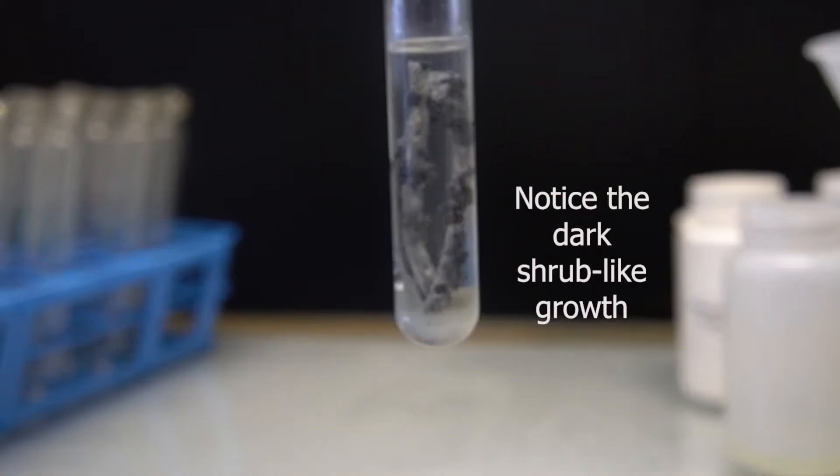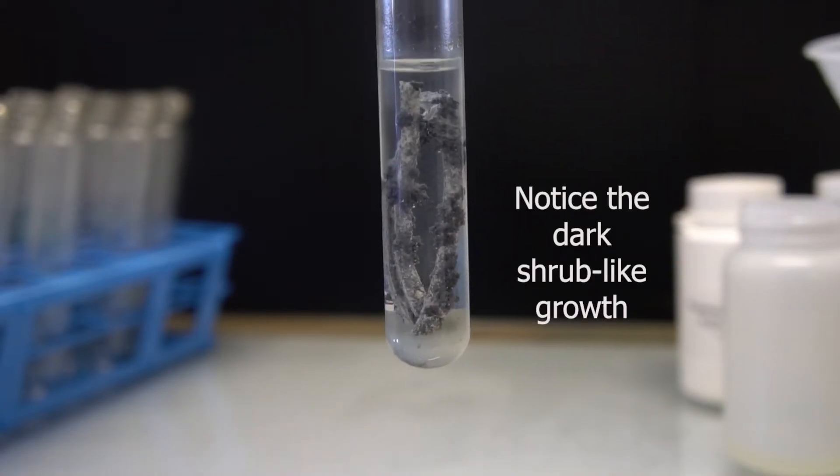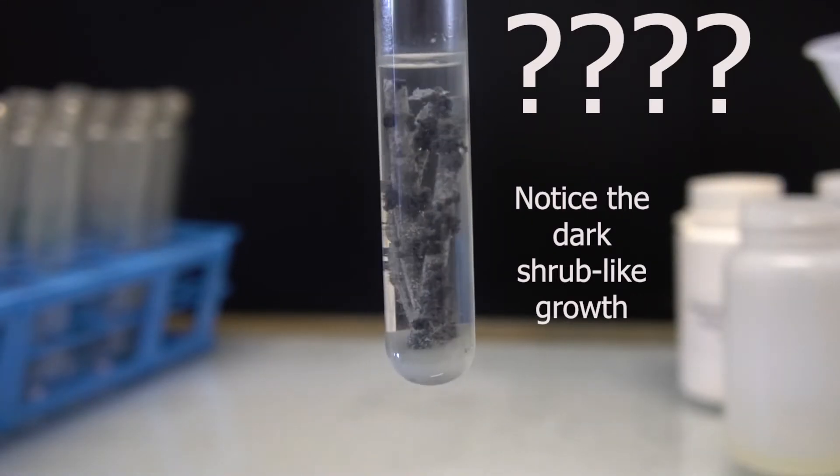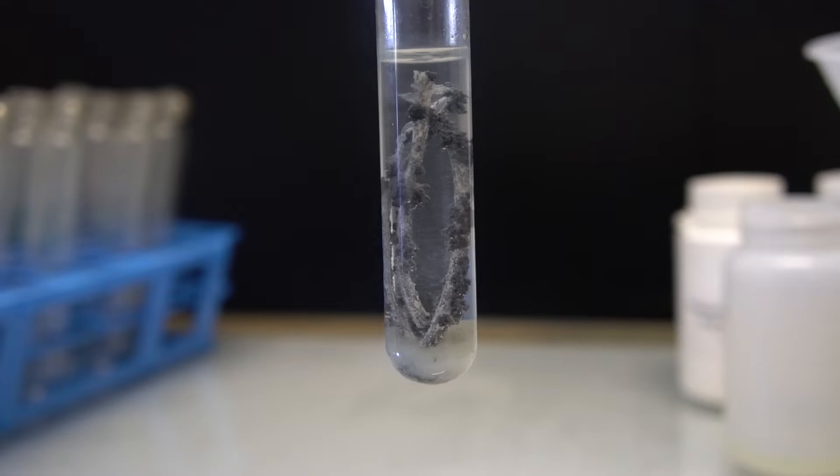Can cyanide solve a mystery? In this video, we will use two cyanide complexes to unravel a chemical mystery on an unexpected appearance in the test tube.